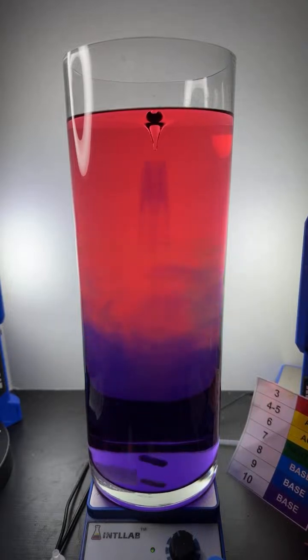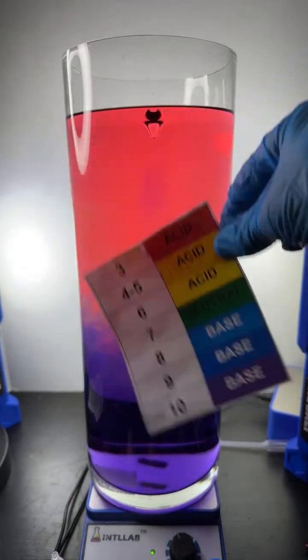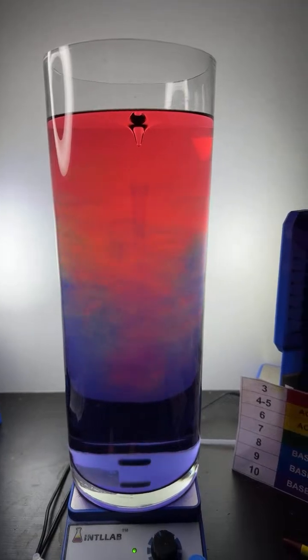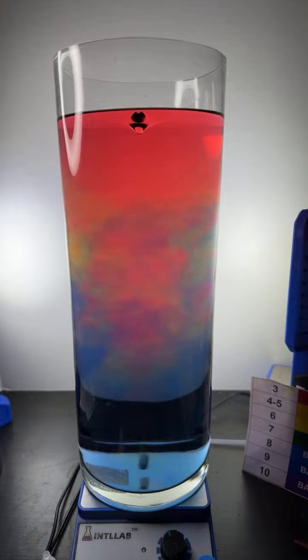Yeah. So that violet color you're seeing is because the pH is changing to 10. The red up here, your pH is 3. That's a difference in pH of 7. Because the pH scale works on powers of 10, that's actually a difference in acidity of 10 times 10, 7 times. Well, that's 10 million.